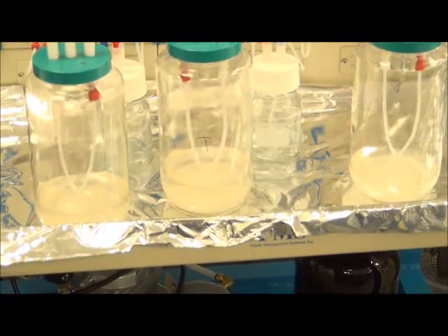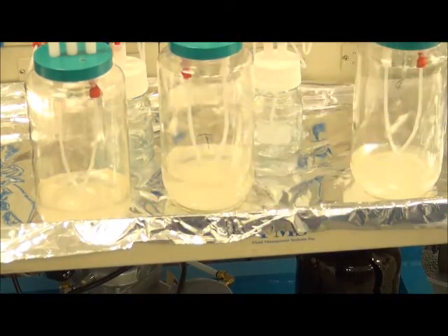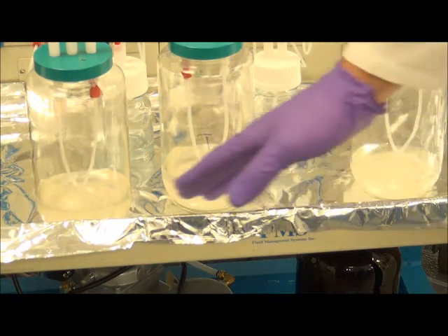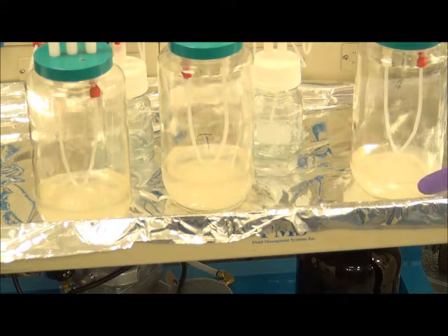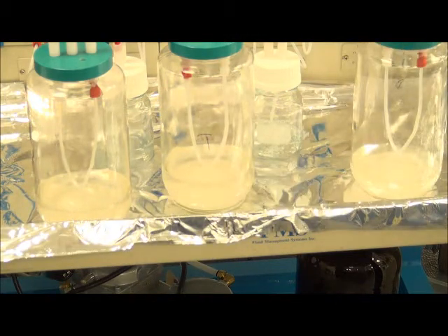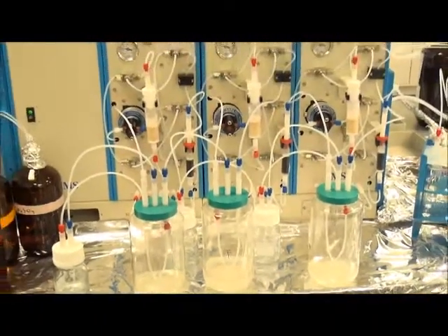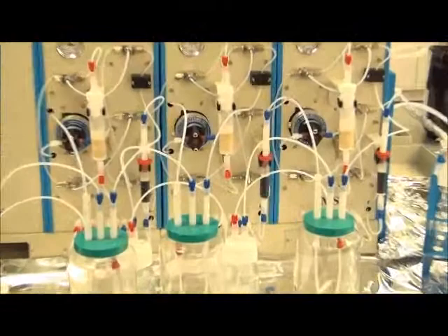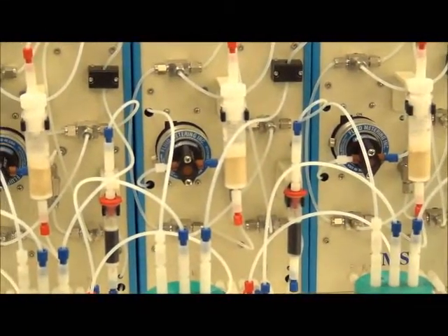And as the sample loading begins to finish, you can see we're getting down to the final mils of the sample. Pretty much a fairly linear sample loading still, even after almost an entire liter of sample. You can see we're also starting to draw up all of that sedimented particles onto the cartridge. And then once those last volumes are drawn up, we'll begin to terminate the loading for individual modules.